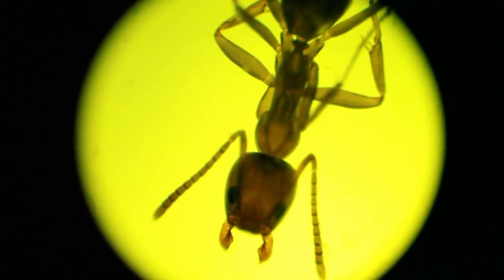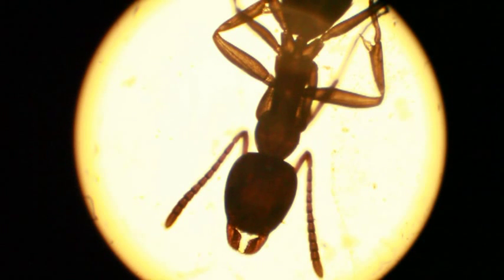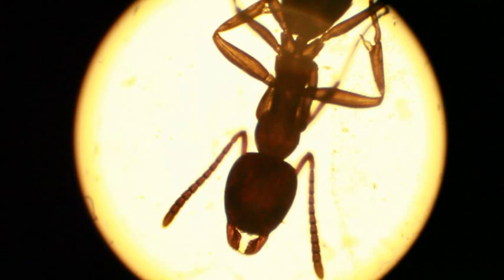I need to get that thing off first. If only things could be done by themselves, that would be a lot better. I'll unwrap this thing and put it back in. It takes forever, especially if you're not used to filters on scopes. Yeah, just bear with me for a little bit.